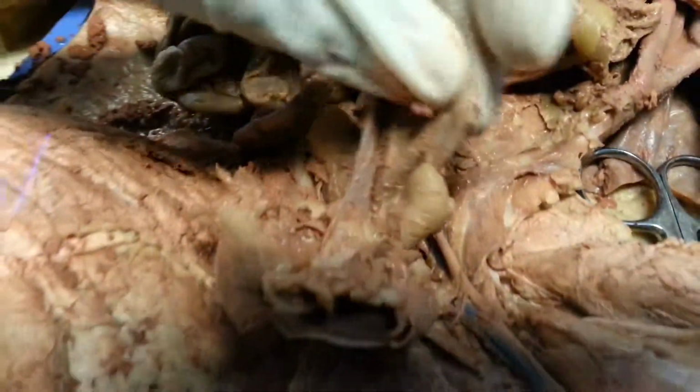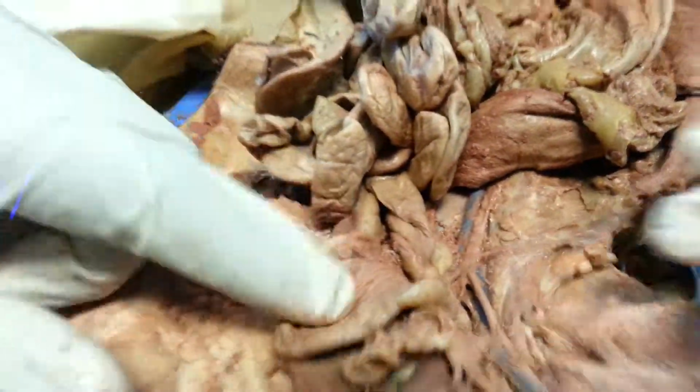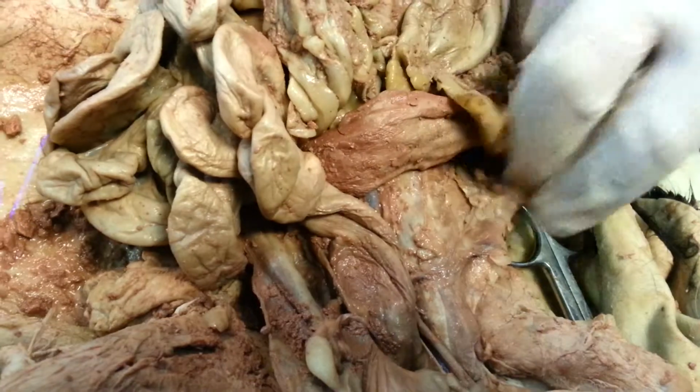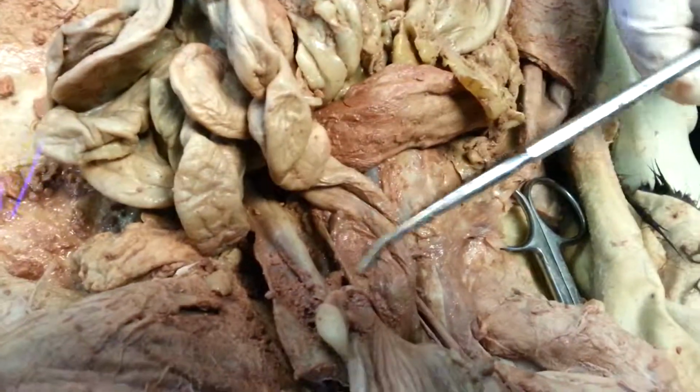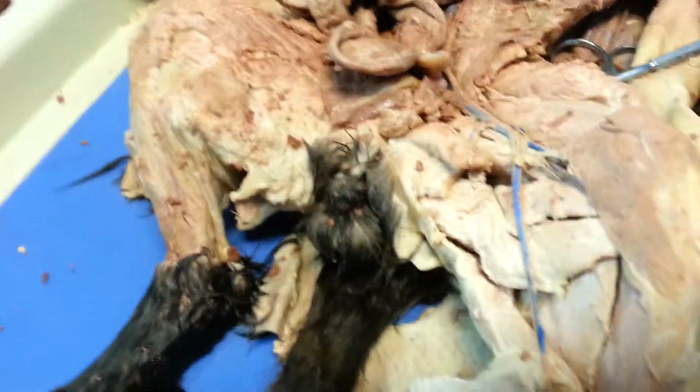This is the bladder. And you guys, as long as we know generally where the hepatic vein is, because you're going to have that exposed in your cat. It'll be next to the liver, right there. Yeah, so that's definitely the bladder. And here you can see one of the ureters coming down there. Oh, you do have good ureters. Yeah, right there.